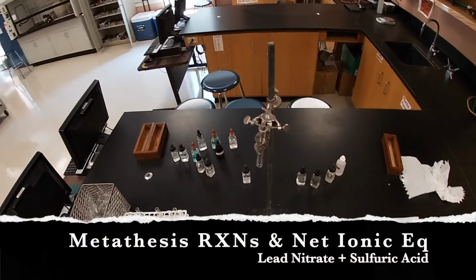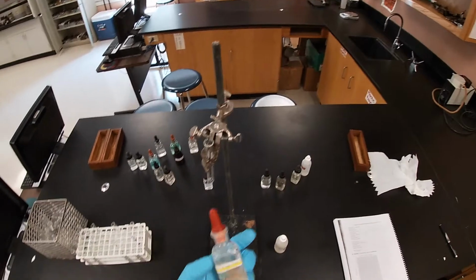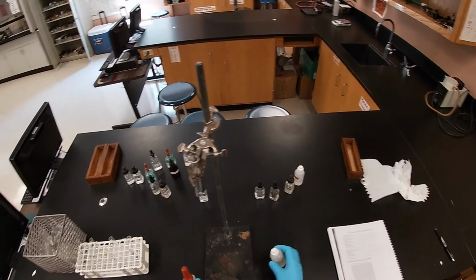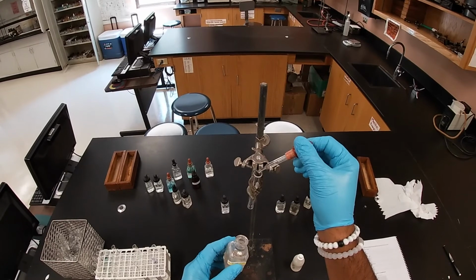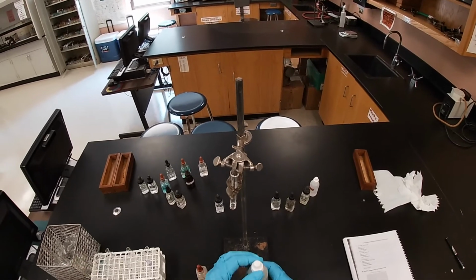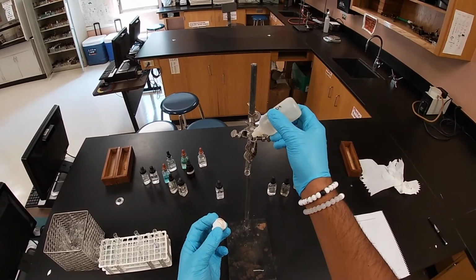Next reaction here, we're going to have a reaction of lead nitrate, hopefully you can see it, and then sulfuric acid. And then I'm going to add a dropper full again of our lead nitrate to our setup. Remember, I've been using a different test tube, not the same test tube. Now I'm going to add some sulfuric acid, and we're going to see some excitement, hopefully.